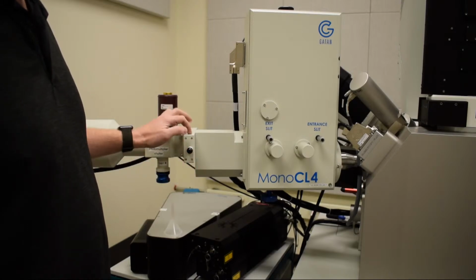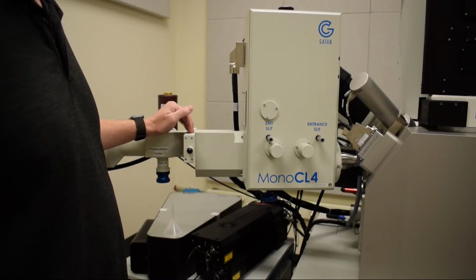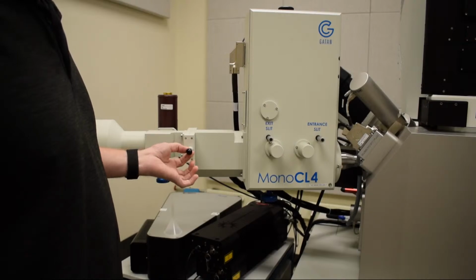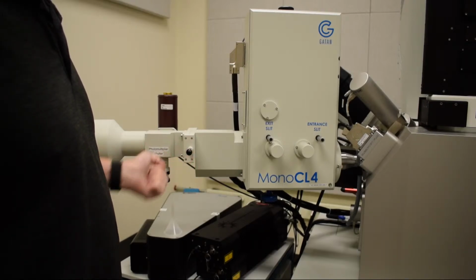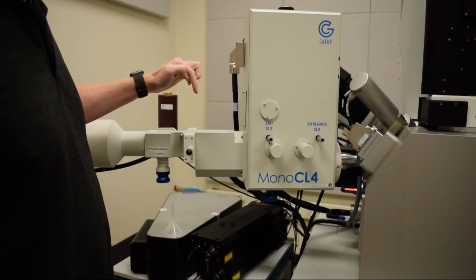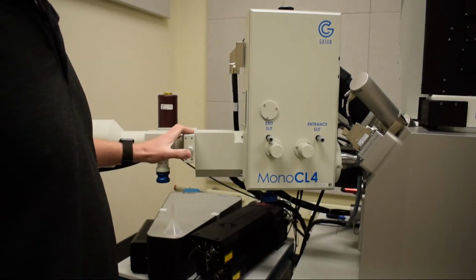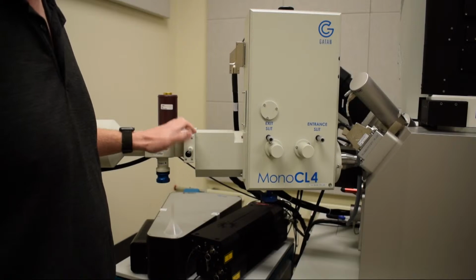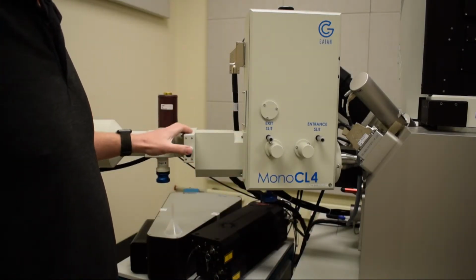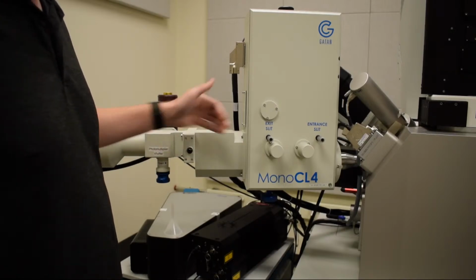We have a red, green, blue filter. And so this is a red pass filter. So the red filter lets only red light through. And you can activate them by pulling until you feel a little stop. There's a spring-loaded, probably ball, that hits a detent, and you can feel when it's in position. This is used when people take composite images and they overlay red, green, blue to get an idea of just the different colors involved. Today we're going to operate with this all the way in, so that's all light passing through.